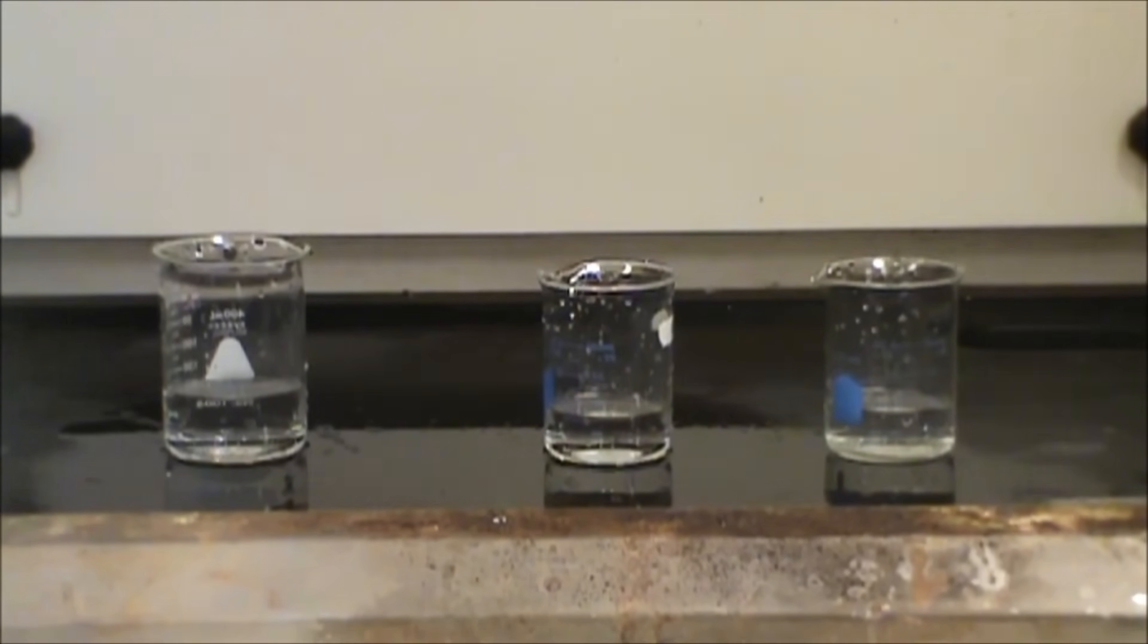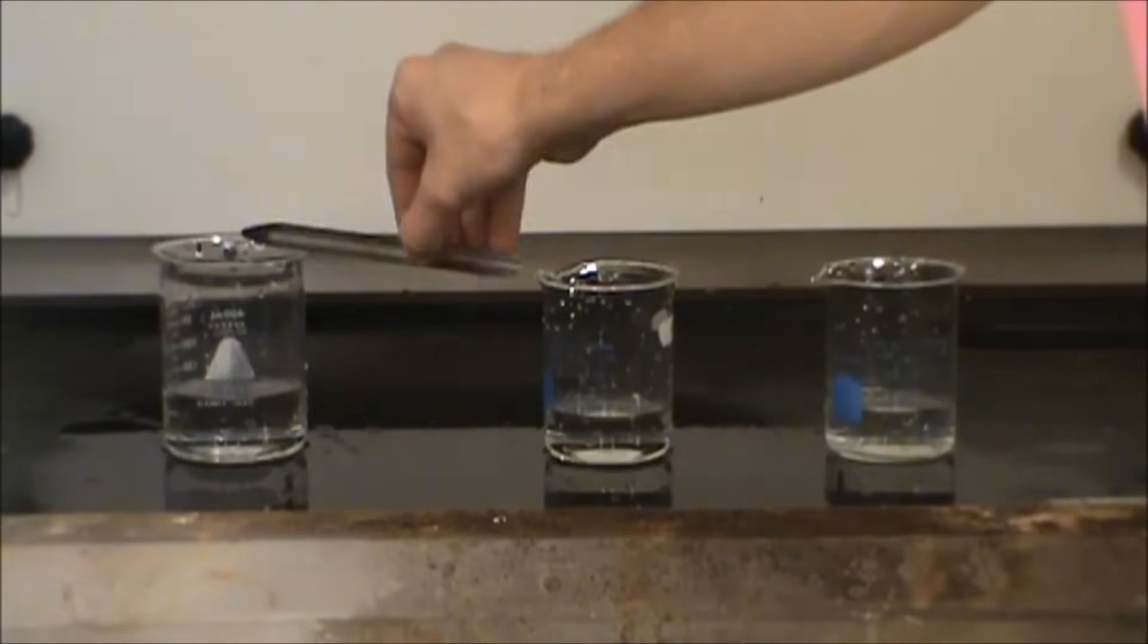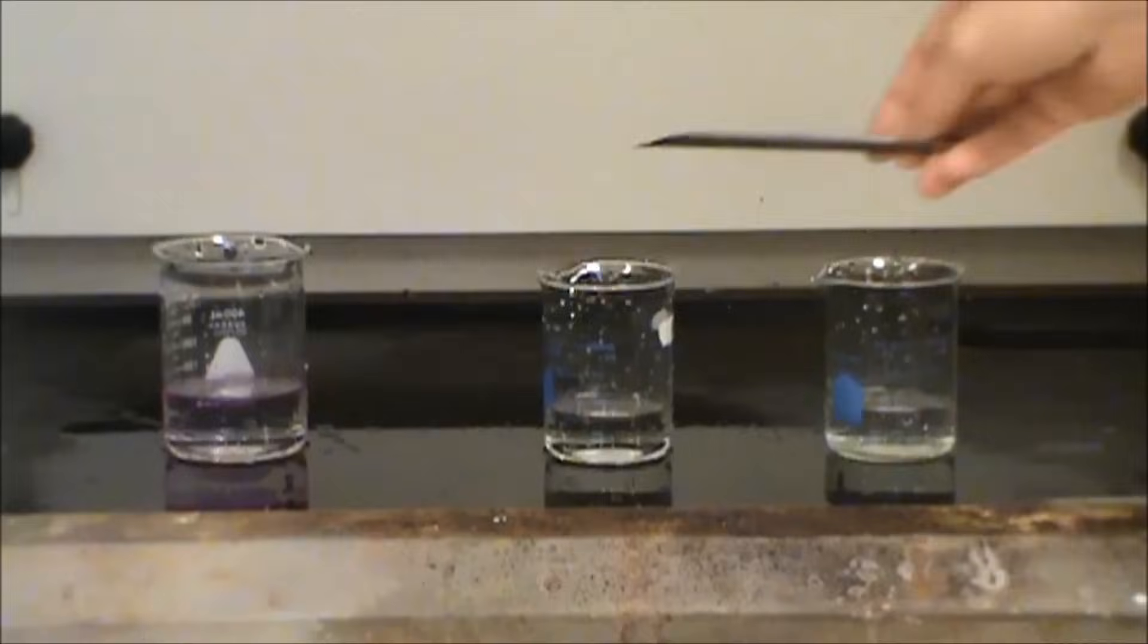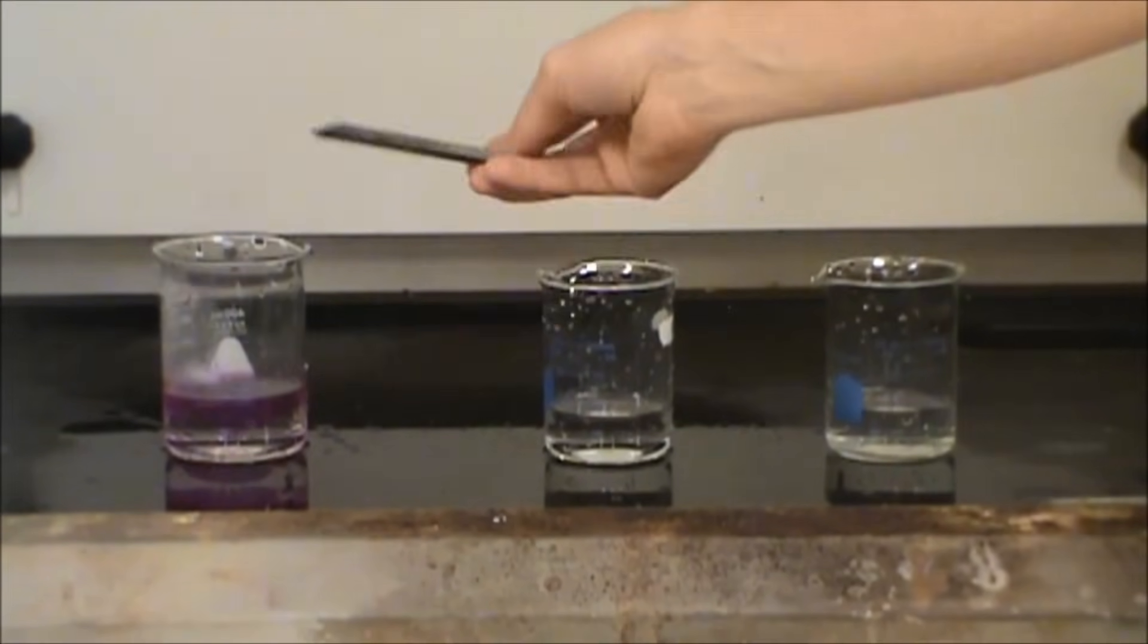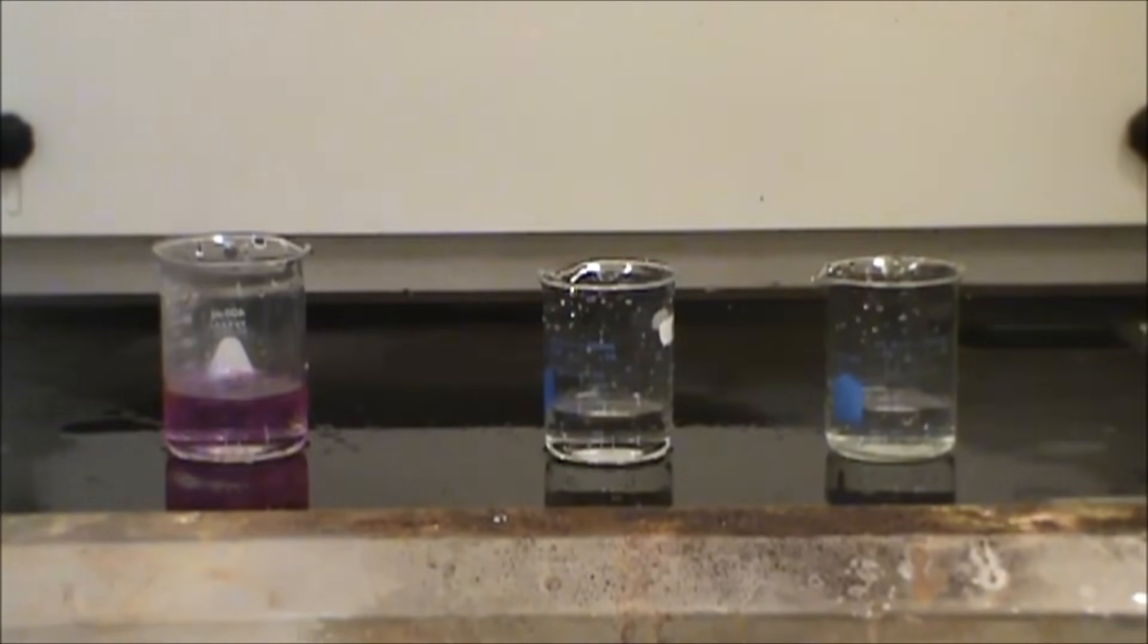It's going to generate hydrogen gas and lithium hydroxide. So you're going to see a pink color develop here, and then you're going to see some smoke come off. That's either lithium metal or lithium hydroxide coming off, maybe a little bit of liquid water. But it's not as reactive as sodium.